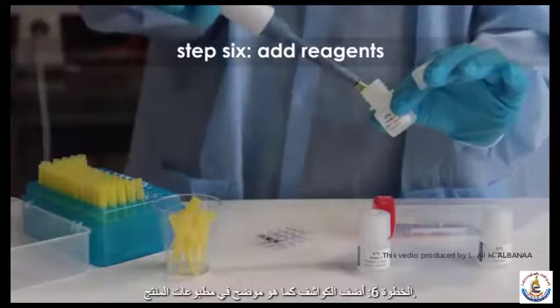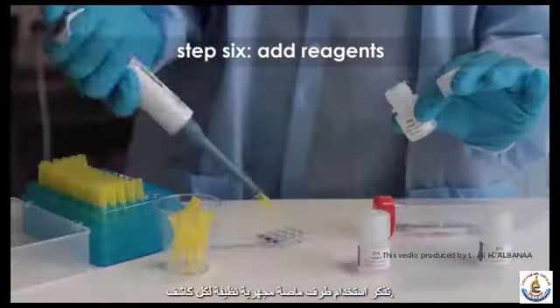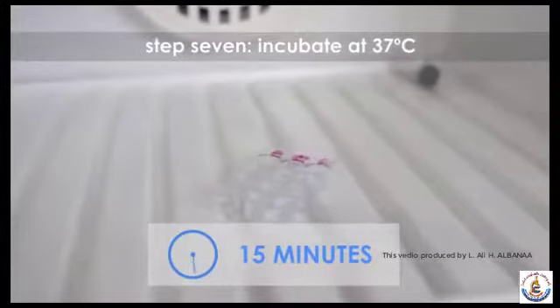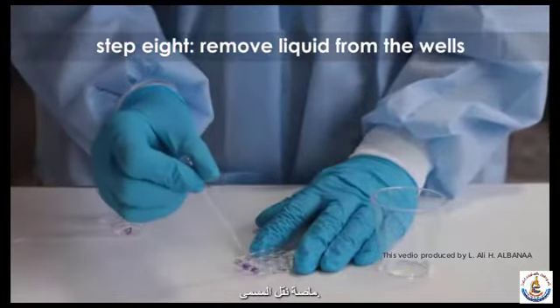Step 6. Add reagents as outlined in the product literature. Remember to use a clean micropipette tip for each reagent. Step 7. Incubate the plate for 15 minutes at 37 degrees Celsius. Step 8. Remove the liquid from the wells using the appropriately labeled transfer pipette.